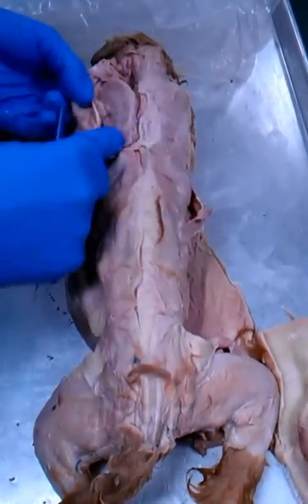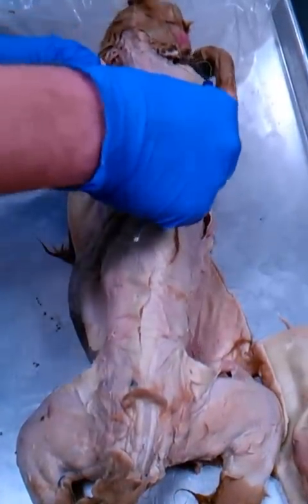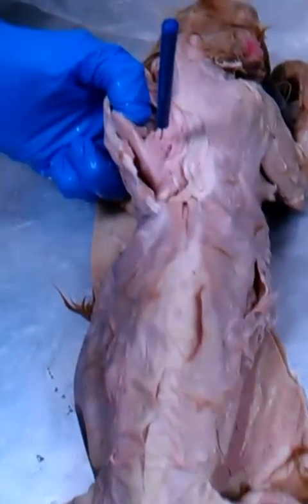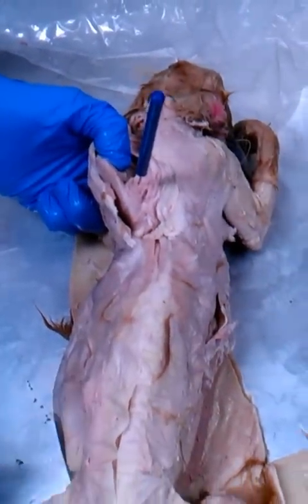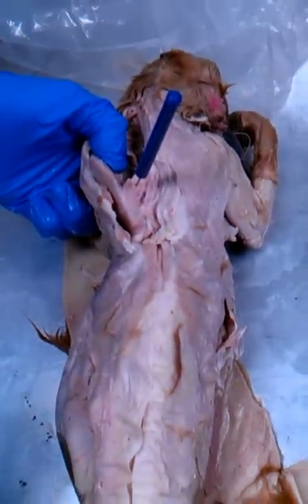We've got several. First of all, if we pull the scapula to the side like this, you can see a muscle from the scapula to the spine right there. That is the rhomboideus. Remember, on the cat, it's just the rhomboideus. On the human, we have rhomboid major and minor, so we have two of them, or we just call them rhomboids.